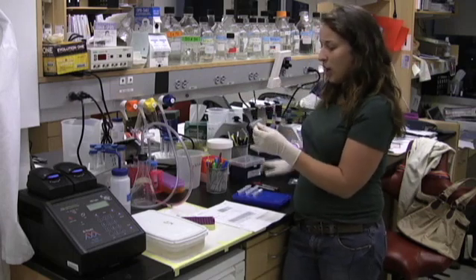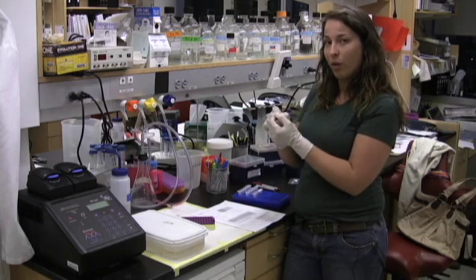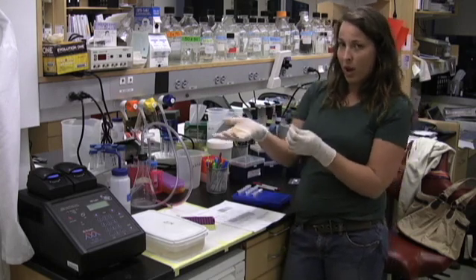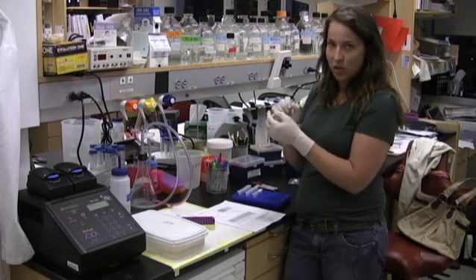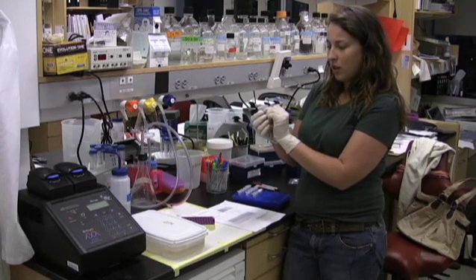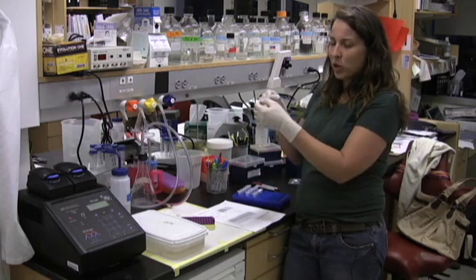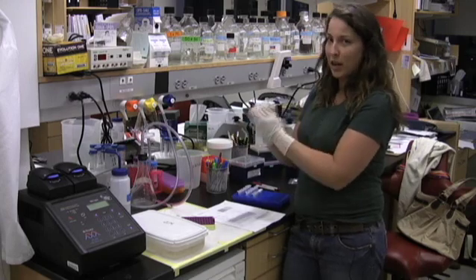And this actually is also handy in case someone takes your tubes out of, say, the PCR block when you're done, and they want to use it next. You know the orientation, so the color is on the front, so if it gets flipped around, you don't have to say, oh no, which one was the first one, which one was the last one. This gives you an arrangement right away.